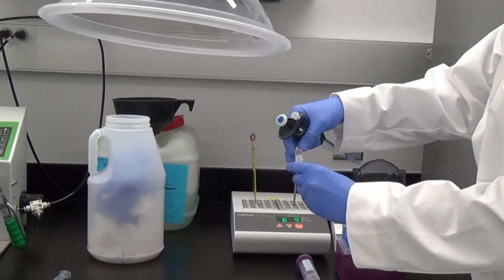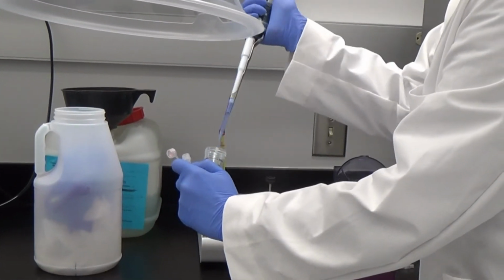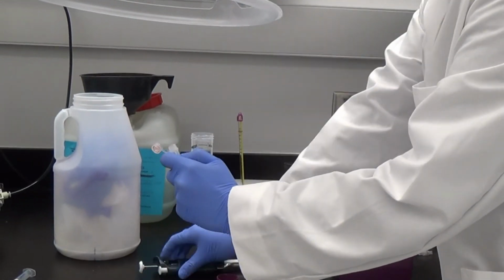After the synthesis, we need to cleave our sequence from the column by putting the column in ammonium hydroxide overnight at 60 degrees.